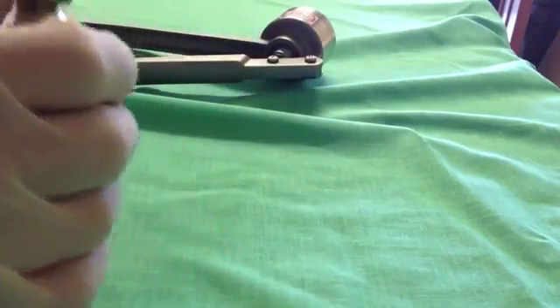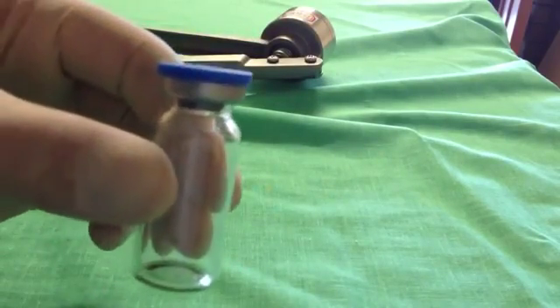And there you have the end result, which should be a fairly nice crimp.